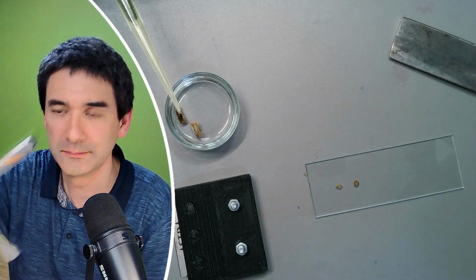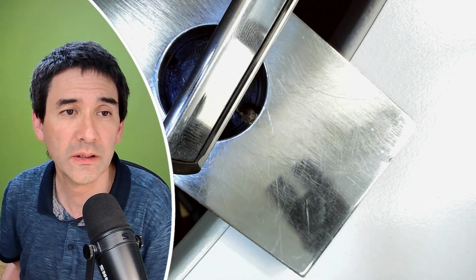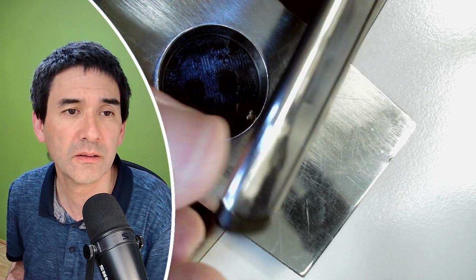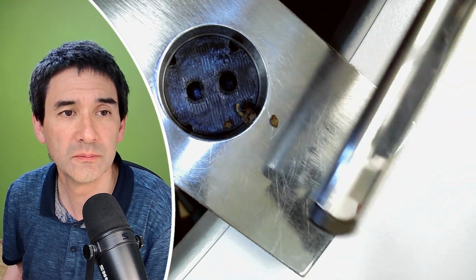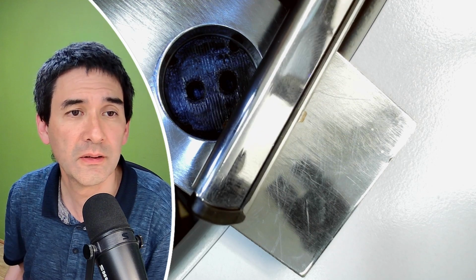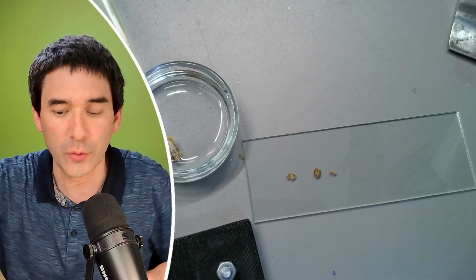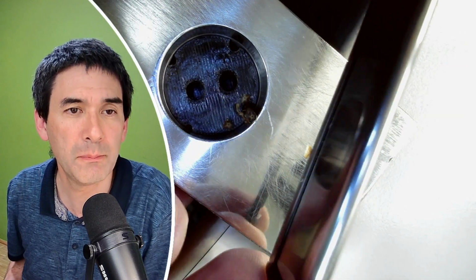the barber one. Now holding, of course, the knife at the correct angle is critical. Yeah. So, okay, here is one, two, three, four, five, six stops. I'm turning it. Yeah, you see this one also works fairly well, because it's a fairly sharp blade. Oh, look, this one actually might be fairly thin. So let's put this here under the microscope. It's not a complete cross section, unfortunately, but let's give it another try. Okay, this might be a bit better. Here it is.